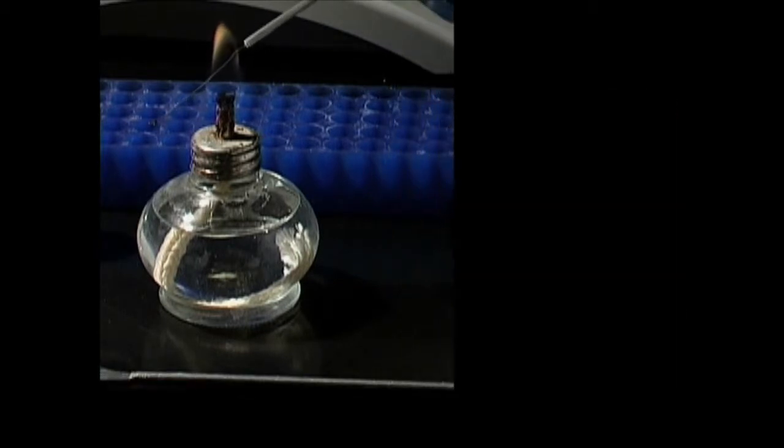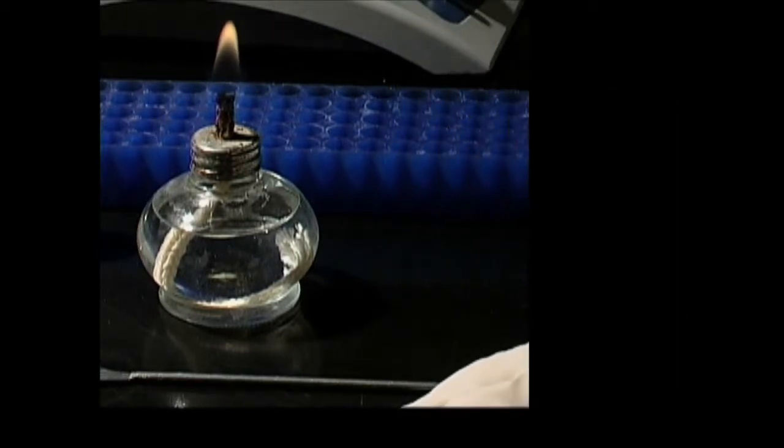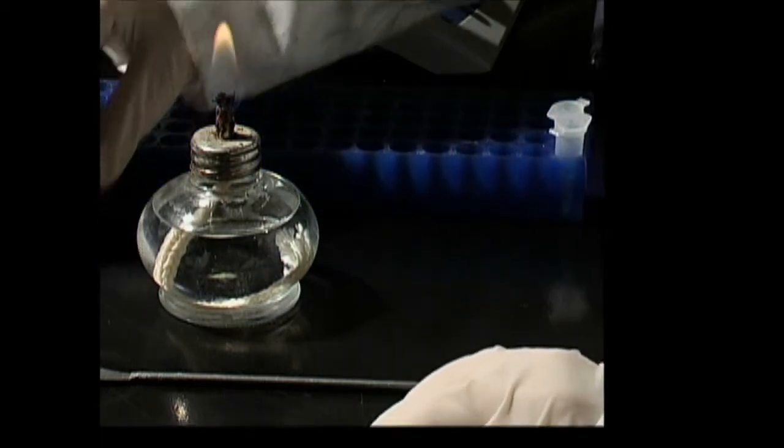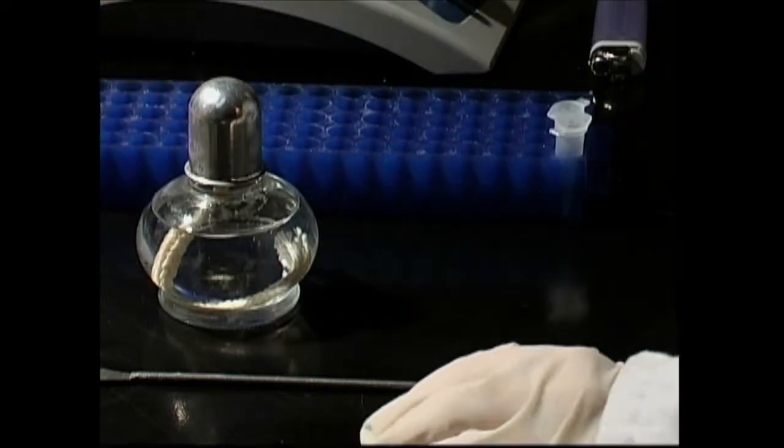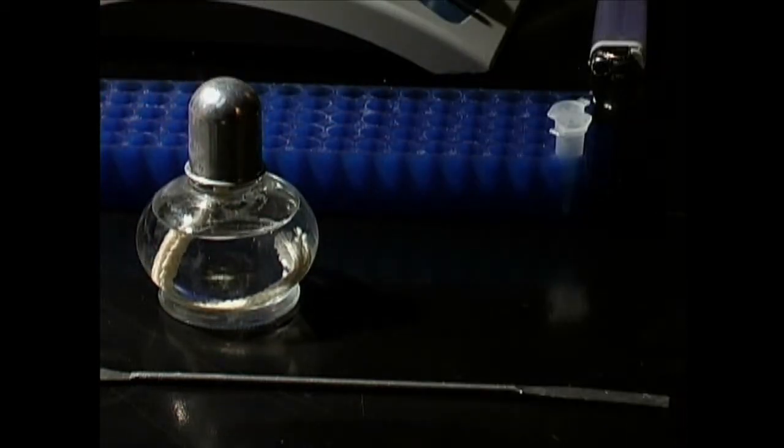Cover the plates and allow the liquid to be absorbed. After approximately one hour, place the plates in an incubator for 15 to 20 hours at 37 degrees. The plates should be incubated upside down to prevent condensation from dripping onto the culture.